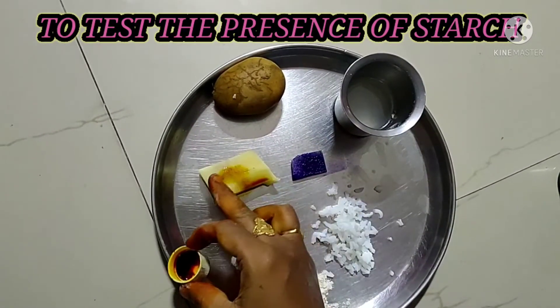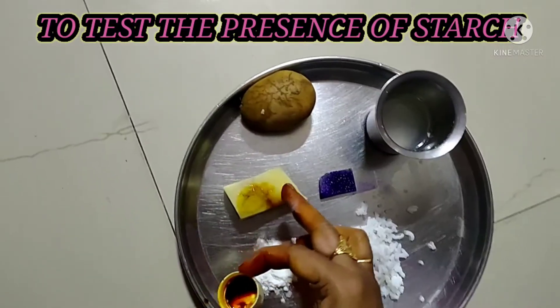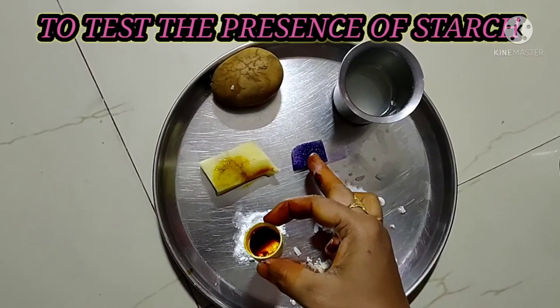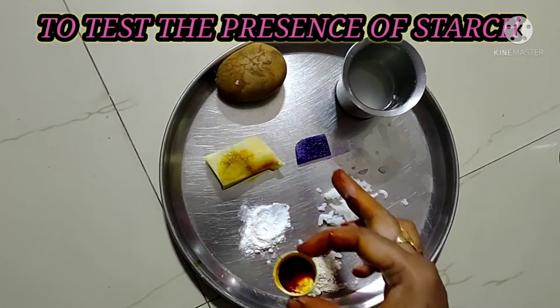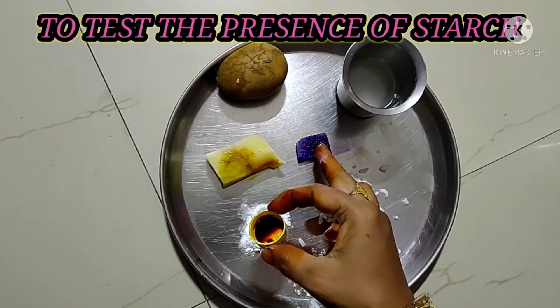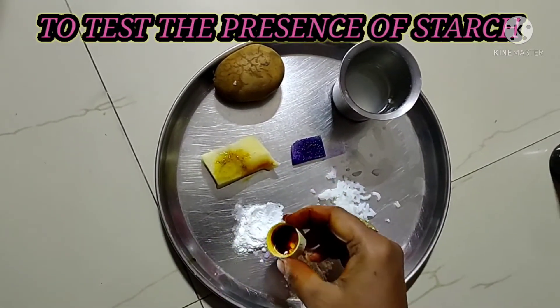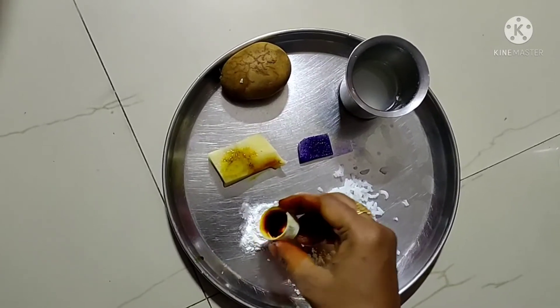The potato reaction will take some time, so I already have a pre-tested one ready. This is the already tested potato. And now this is rice flour — see.